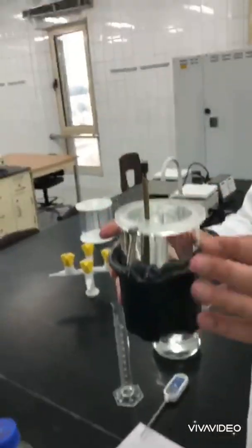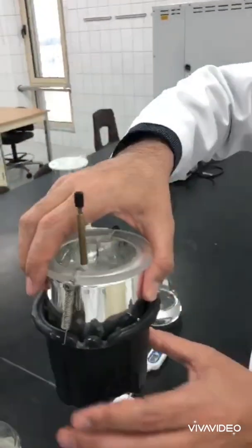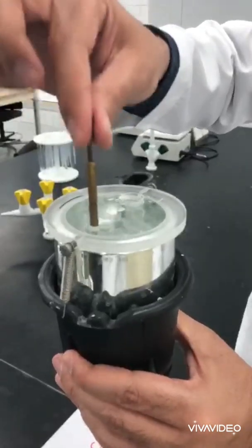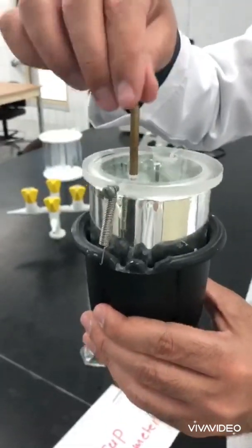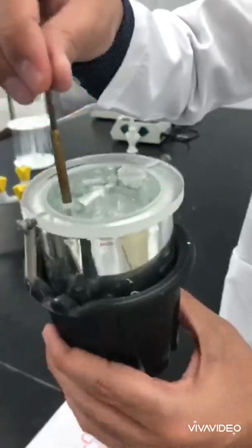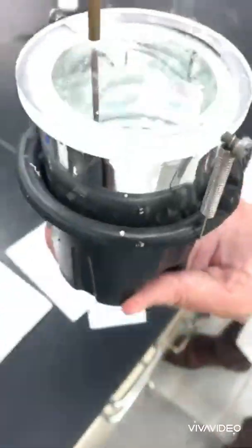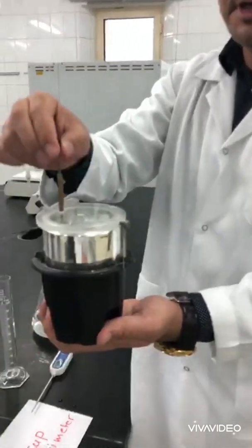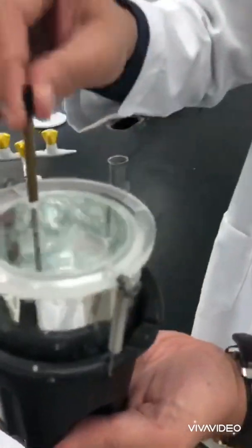As we explained in the class, all calorimeters should be isolated to prevent the releasing of heat outside. Now I will start stirring until the whole amount of sodium hydroxide is dissolved. Every 30 seconds to one minute, record the reading. The maximum reading reached during the experiment will be the one we use. I am trying to dissolve the whole amount of sodium hydroxide. This is a physical process — solution formation — but it is exothermic, so we expect the temperature inside the calorimeter to increase.